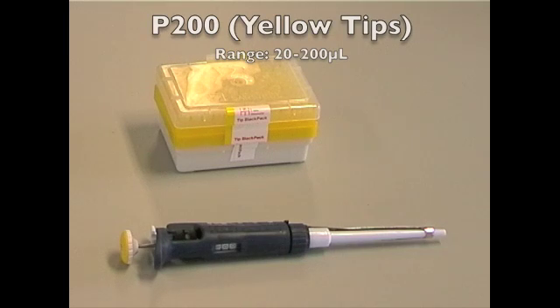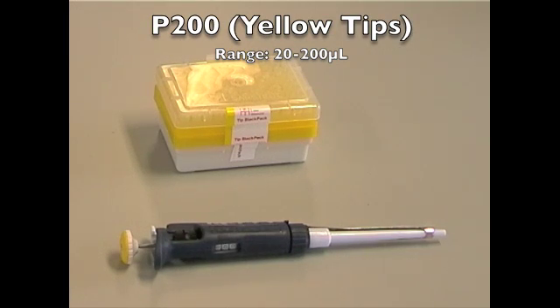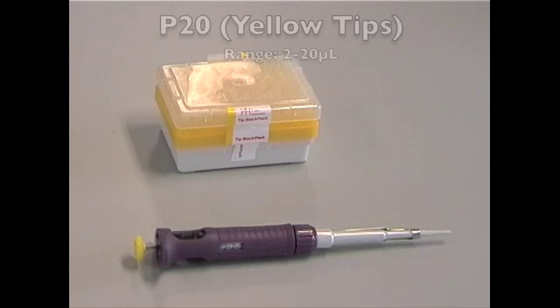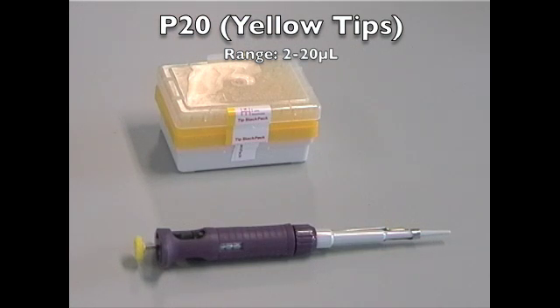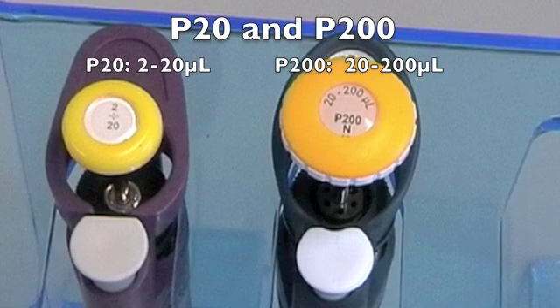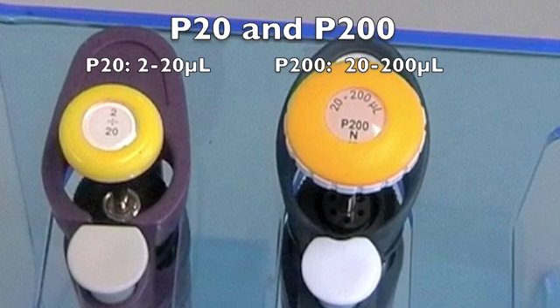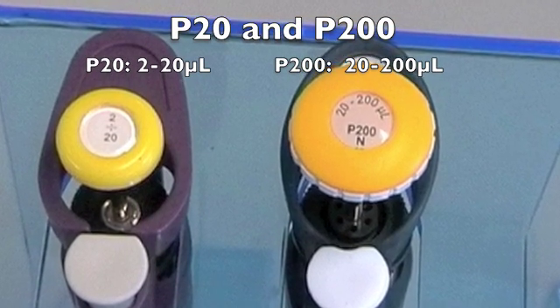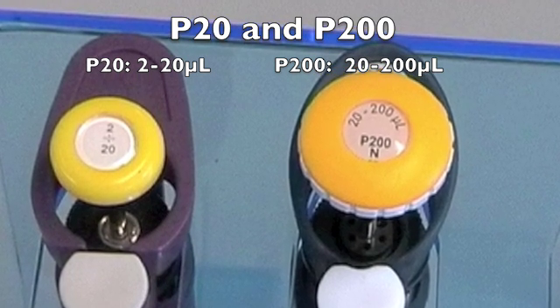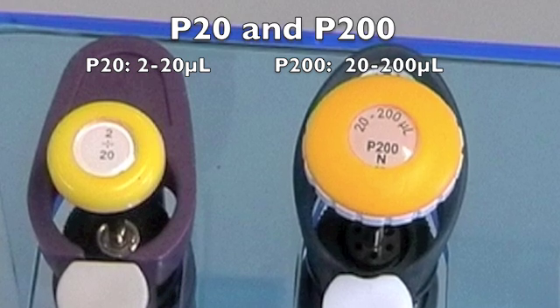The P200 has a range of 20 to 200 microliters and should only be used to measure within this range. The P200 is compatible with the yellow tips and will not work with the blue tips. The P20 has a range of 2 to 20 microliters and should only be used within this range. The P20 is also compatible with the yellow tips, much like the P200. Neither pipette should be used outside of its stated range.